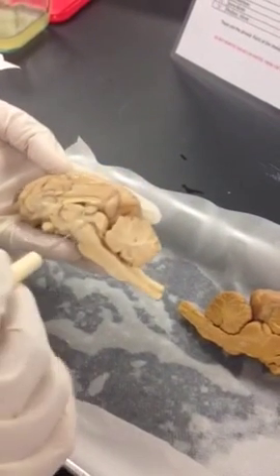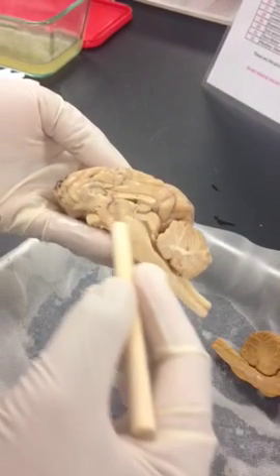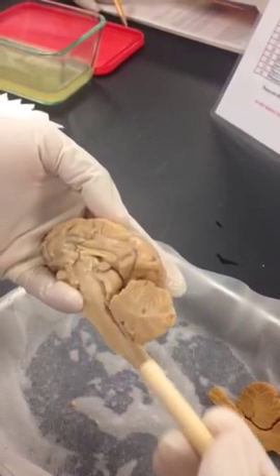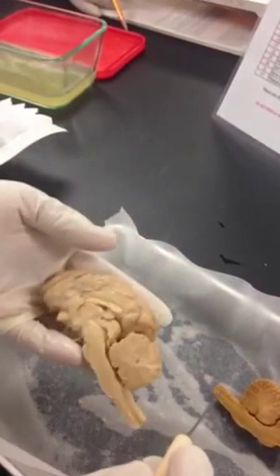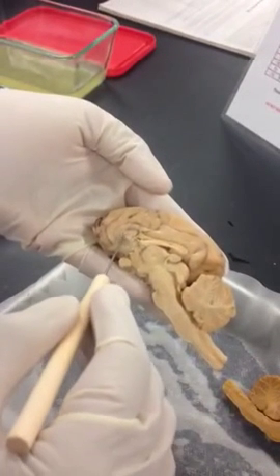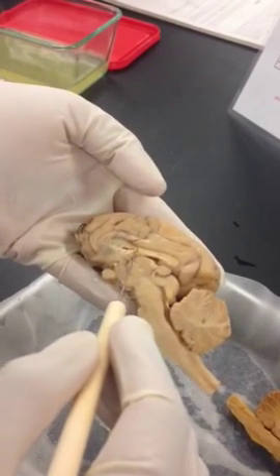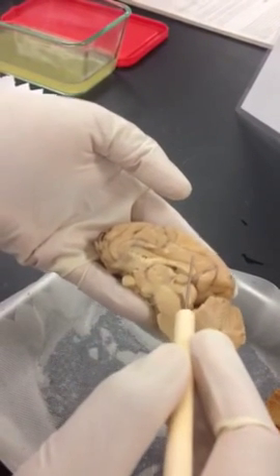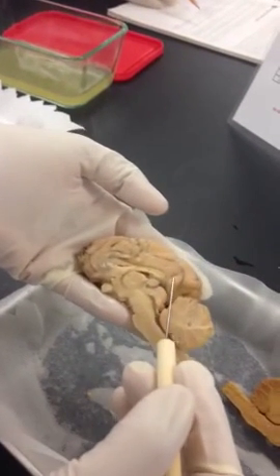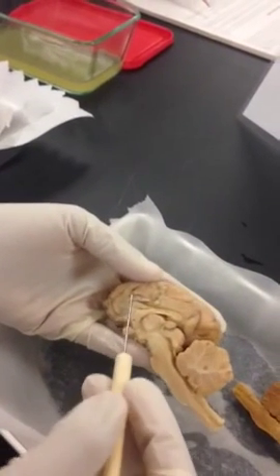So for the most part, what is obvious here, again you can see the most of your brain is your cerebrum, right? And here you have your cerebellum, right? And then if you see in the middle of the brain you have this C-shaped structure. It looks like a letter C going all the way from here to here, right? Comes around. Can you all see that? Or find a position where you can see my hand and the brain. Please come behind me. Or okay, I'm trying to show everybody as clearly as possible.